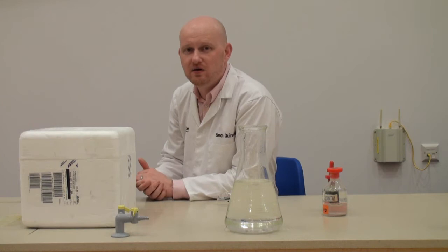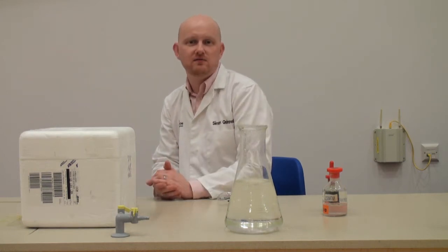Hello, here we have a really nice chemistry demonstration, which could be used to talk about the properties of gases, acids and alkalis, or even used as open evening material.